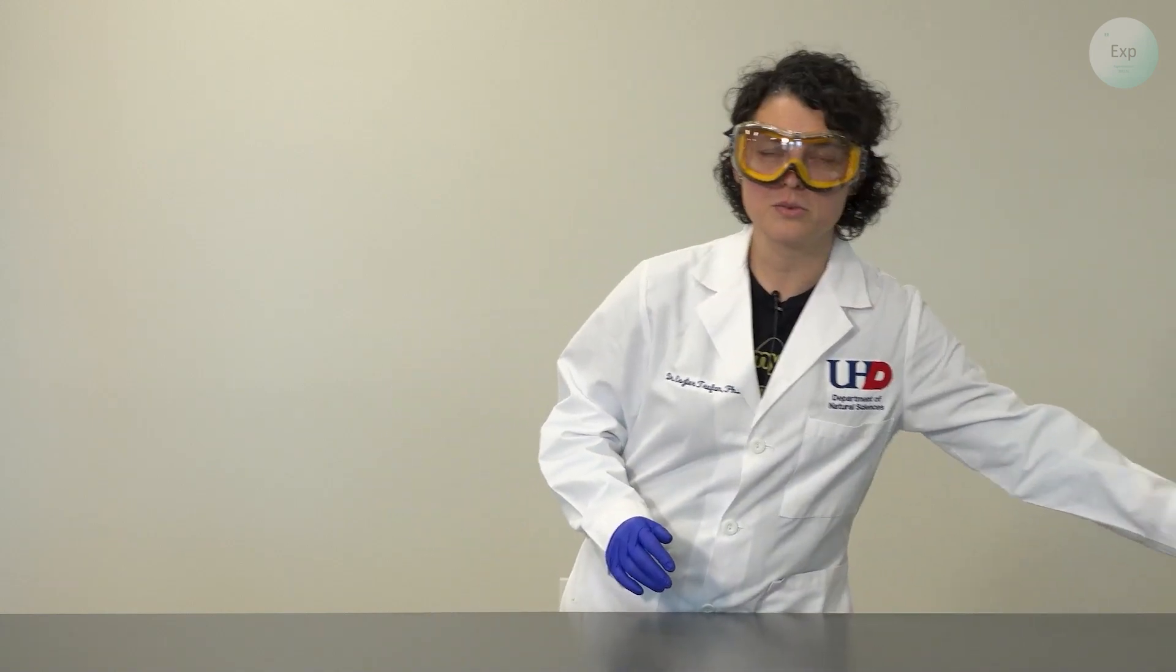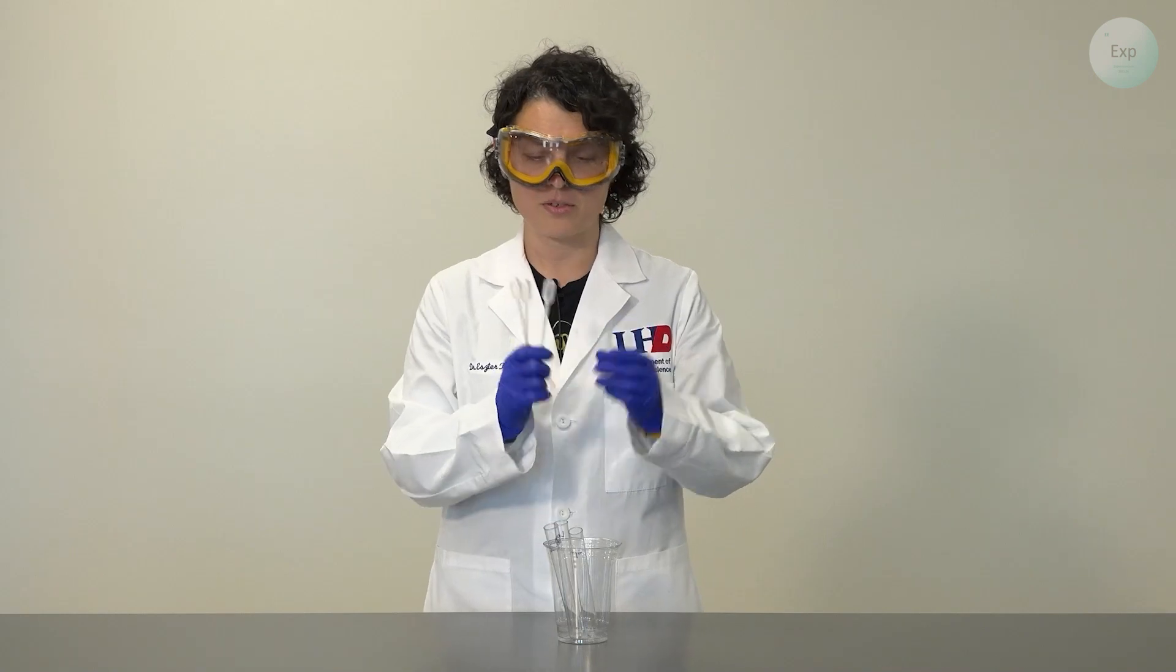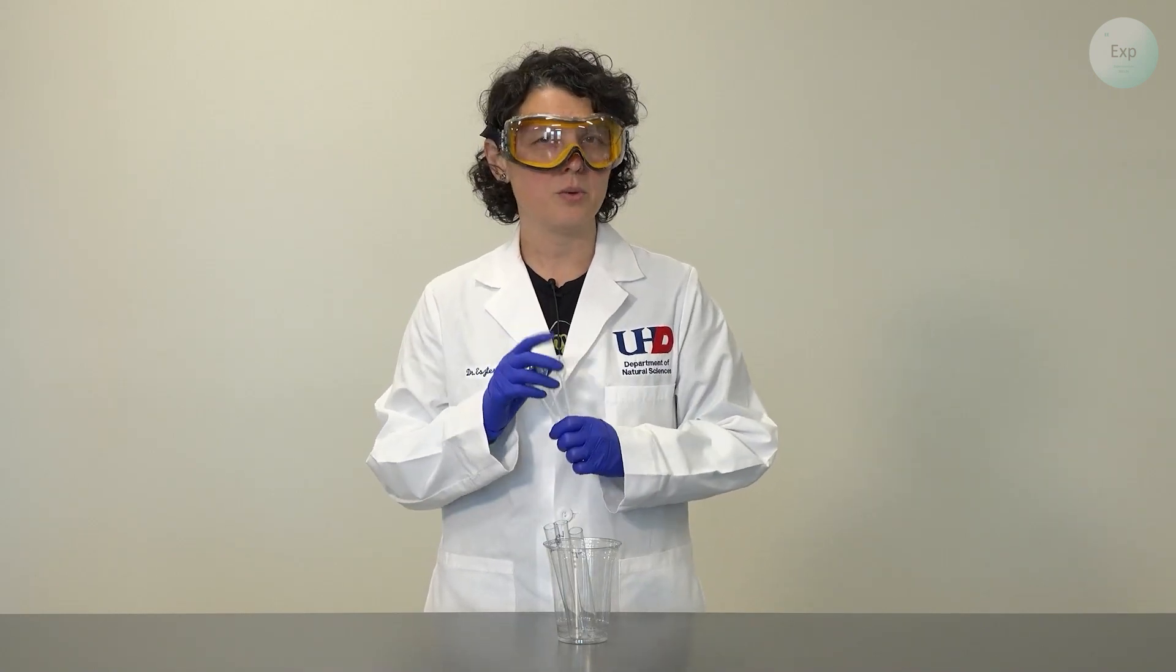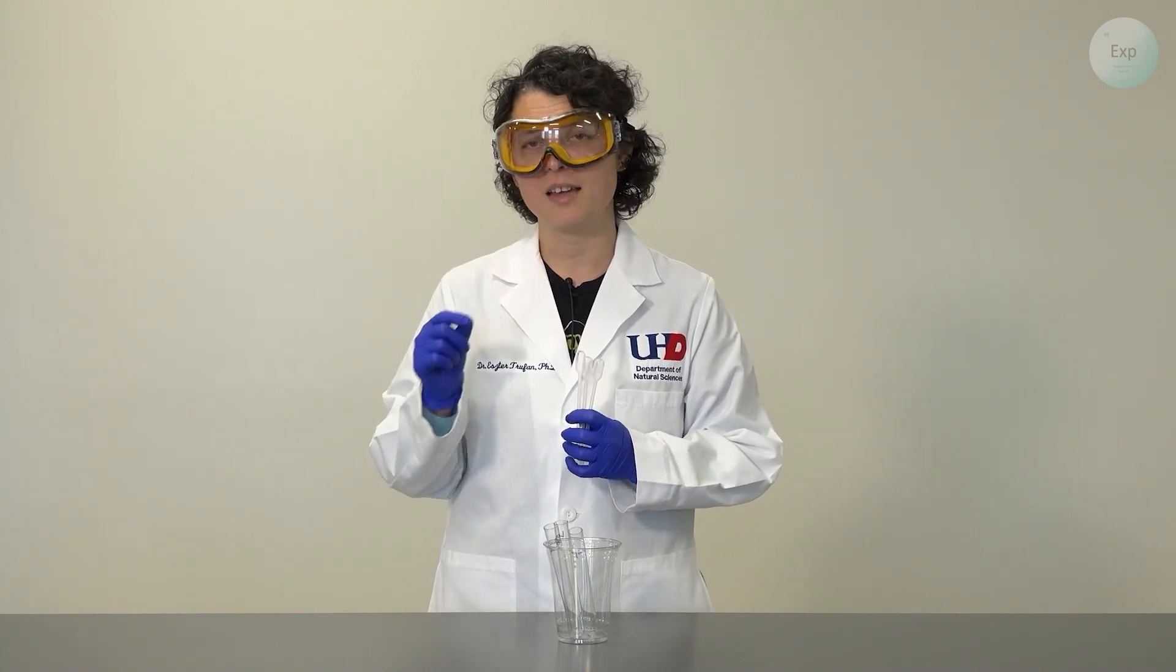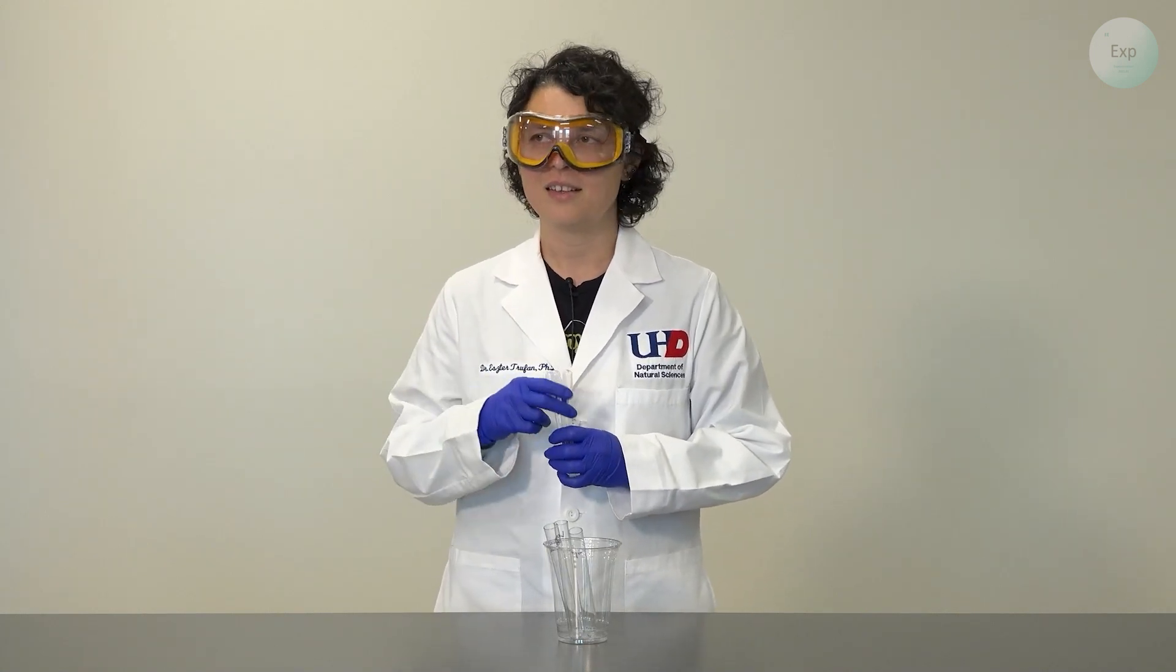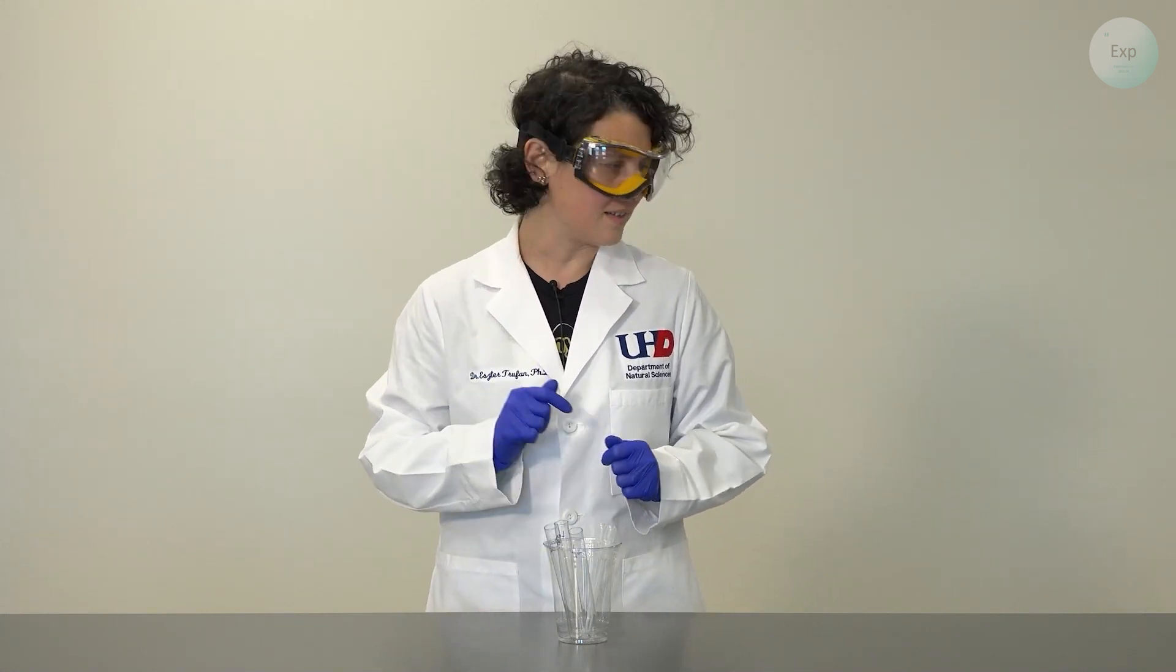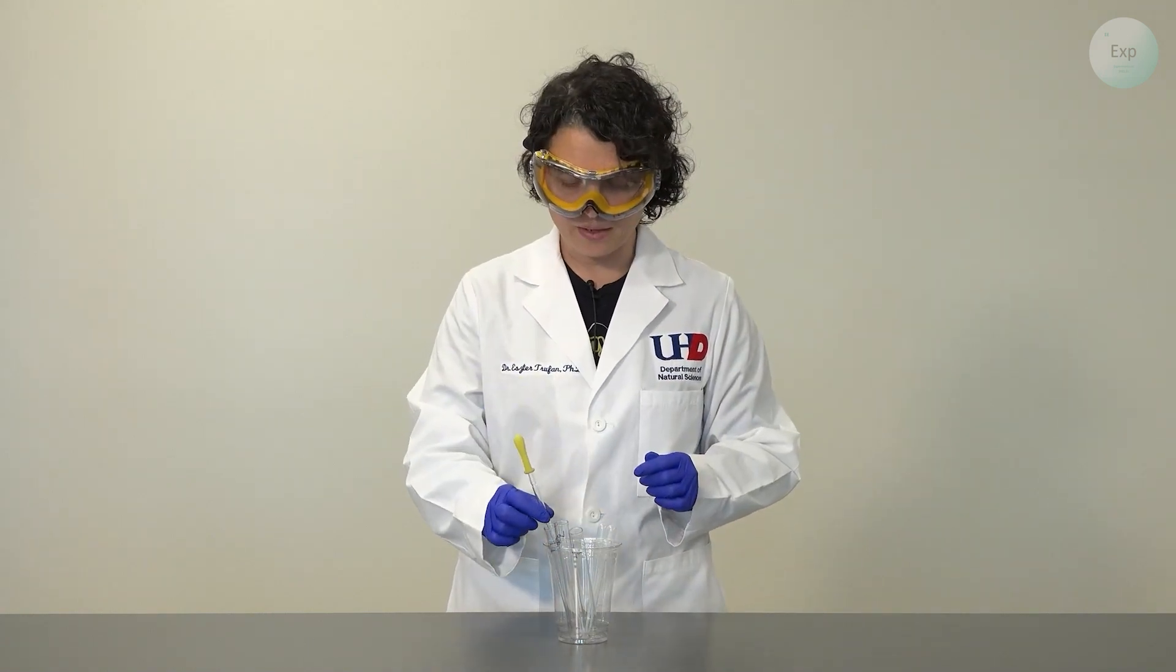For this experiment I'm going to use three test tubes and to transfer the materials I'm going to use three pipettes. I'm going to use individual pipettes for each one but if you are sharing one pipette among the experiments, just keep in mind that between tests you need to clean those pipettes and then move on to your next test. I will also need a separate pipette to transfer my indicator solution.